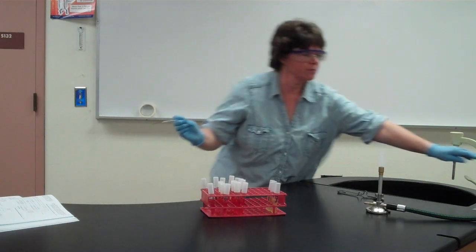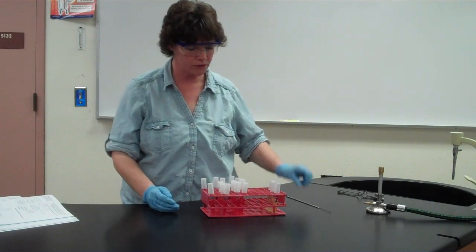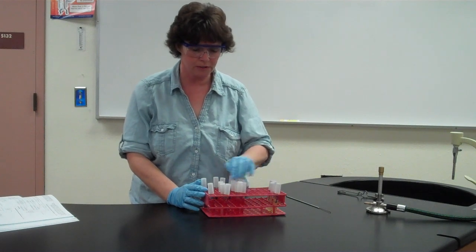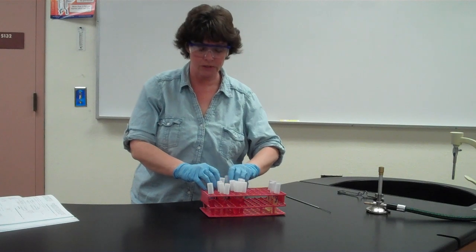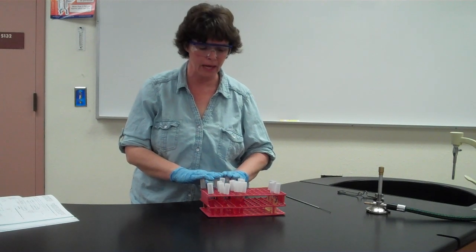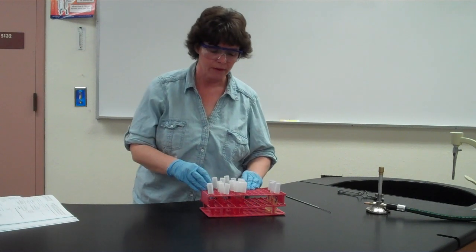Okay? You would repeat that procedure with all of the sugars, so putting this bacteria into the other 2 sugars, then this bacteria into the 3 sugars, and so on and so on. You will not put any bacteria into the controls, because those are just going to show what they originally looked like. Okay? You will still, however, put them in the incubator so that they can be a true control.